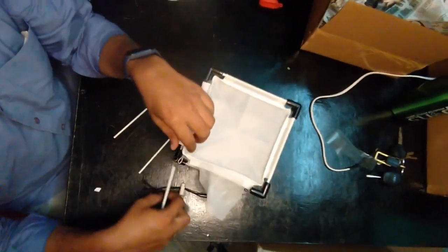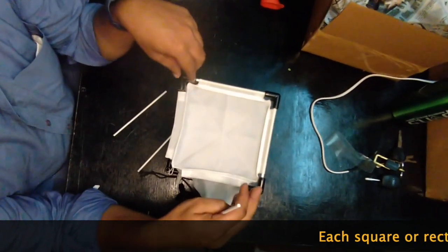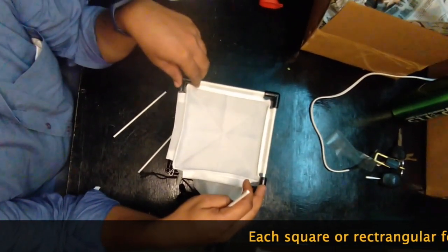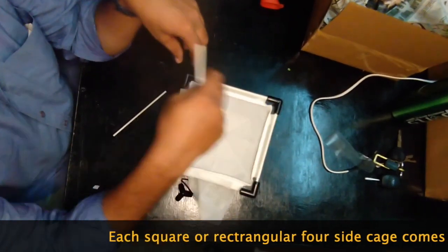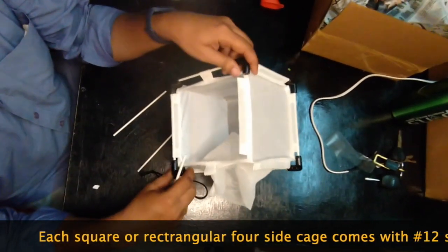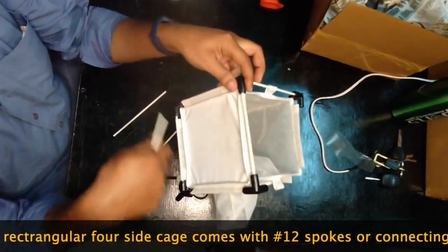For this cage, say for example YS 1515, you receive four black corners... I'm sorry, eight black corners: one, two, three, four, and then four here. Four plus four equals eight.